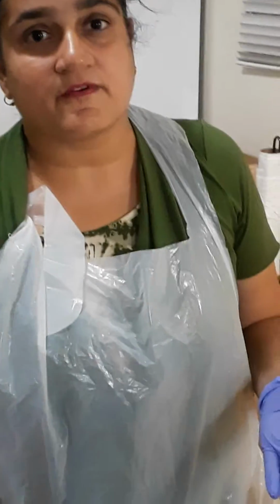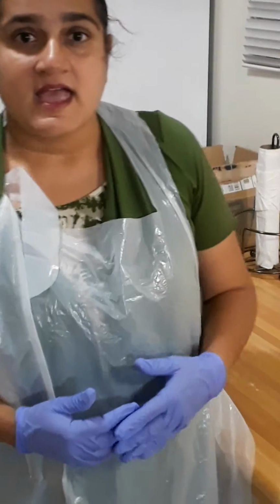This video is related to my experiment, Aseptic Techniques and Culturing Microbes, and this is week 2 of the Bio 225 class. In this video I am going to discuss my observations and the results I got after culturing the E. coli, yeast and the Staphylococcus epidermidis, preparing the active cultures, and after 72 hours keeping them for incubation again in the agar plates. And this is what I got.